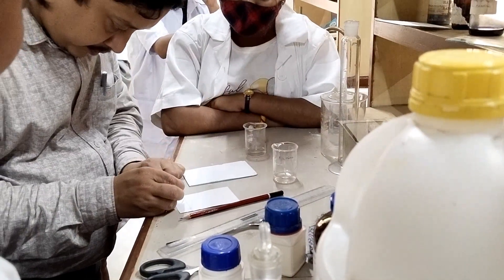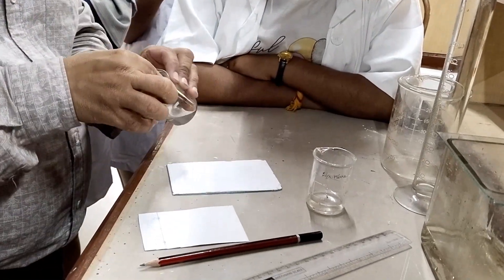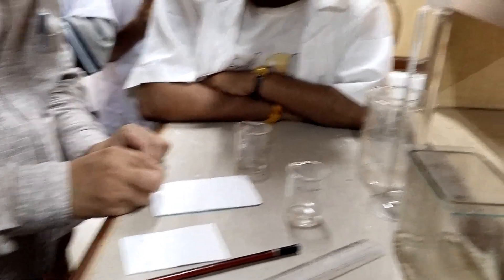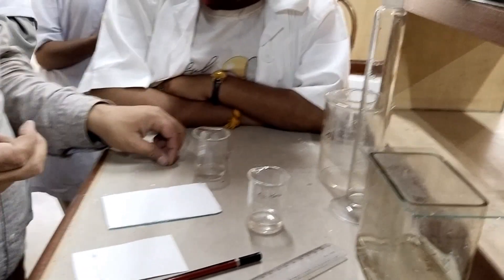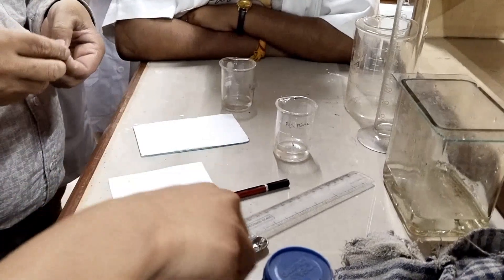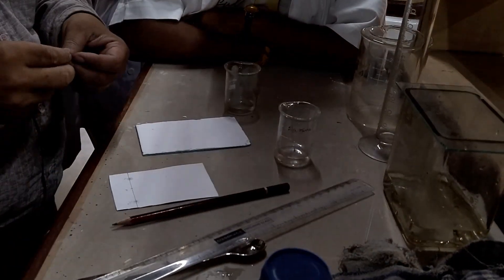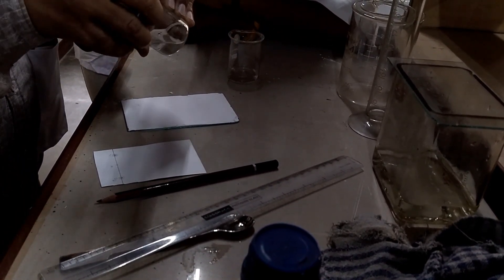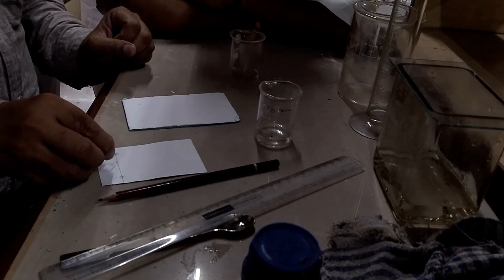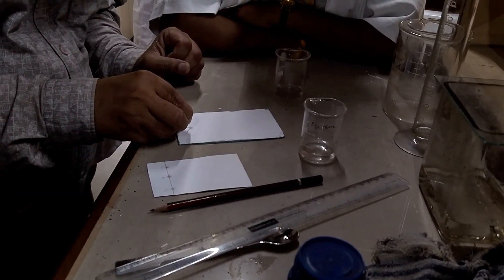Let's move to the experiment. You can see two plates lying side by side, and Sar is going to spot the plate — that is, put the samples on this plate. He is using a capillary, which is used to keep the measure of the sample consistent. Once you put the capillary into the sample kept in the beaker, the sample will enter the capillary, and he simply puts it on the line. There is a straight line pattern drawn over the plate, and it is important that samples are spotted on the same line.